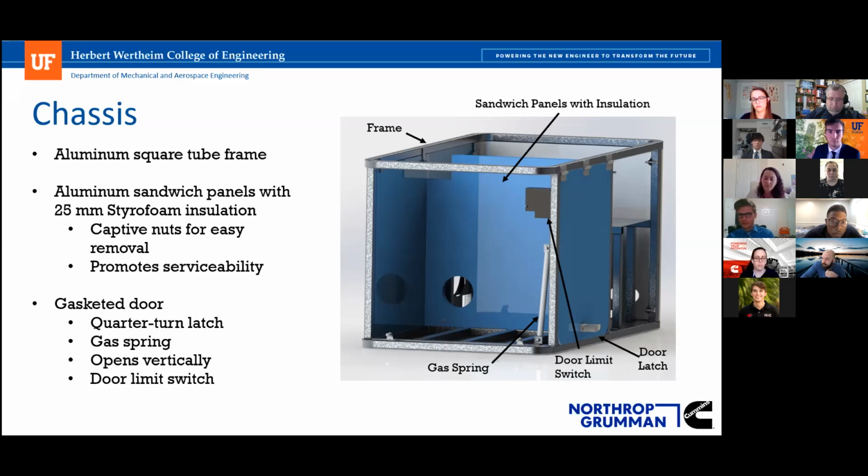The panels themselves are not meant to be opened or disassembled while the system is moving. The door is the only point of access, but because they are so easy to remove, we felt that was the better solution in terms of serviceability and adding on to the thing. As we improve the design and go into the prototyping phase, it's very easy to service and disassemble.